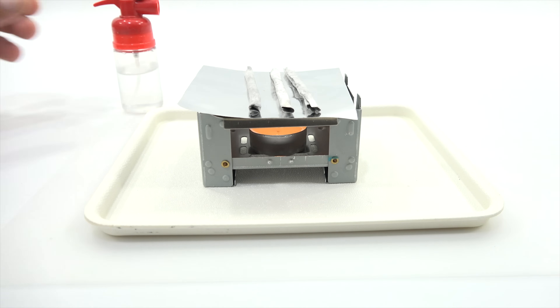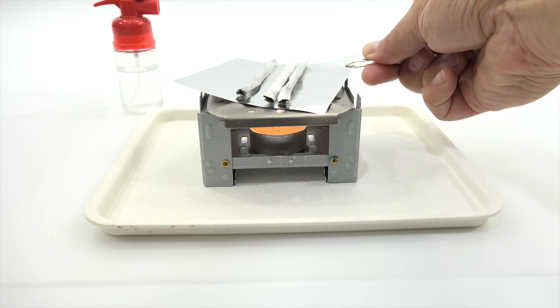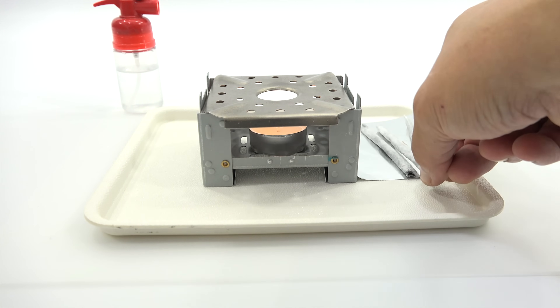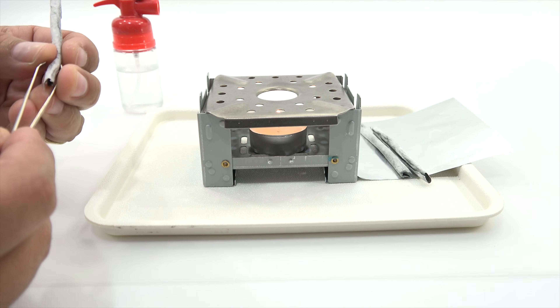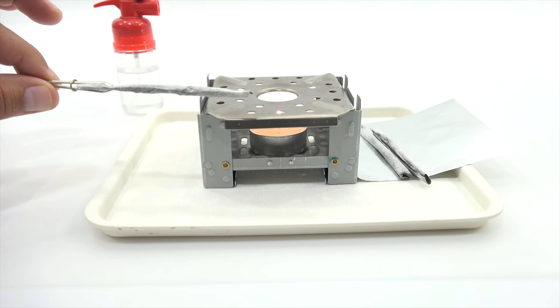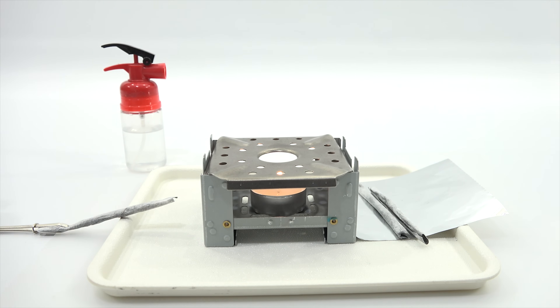It has been ten minutes, and you can tell they have totally changed colors. Now they want to remove this. They show you lighting from the candle, but I'm not going to touch that metal base. They show you clamping one — and this thing has a little ring on it, so that should tighten it up so you don't have to worry about your hands. Okay, look at that — now that is ready to go. I'm going to light this one. I've got three so I can experiment a little. Here we go.